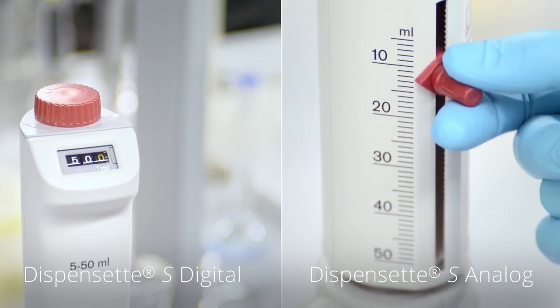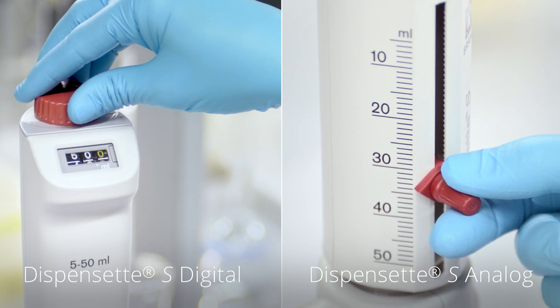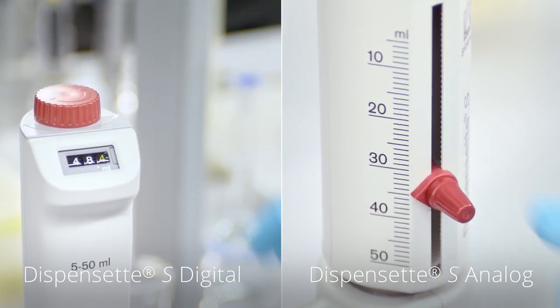There are two easy-to-use types of volume adjustment, analog and digital. Just set the instrument to the desired volume.